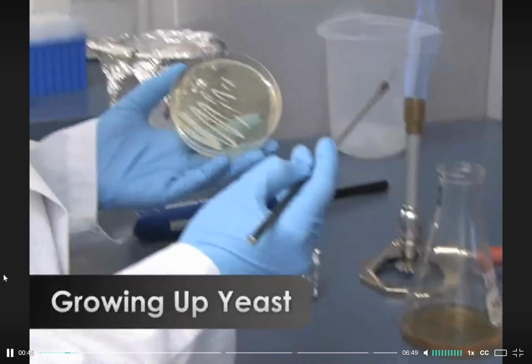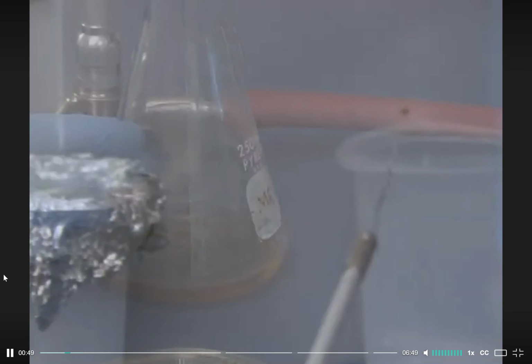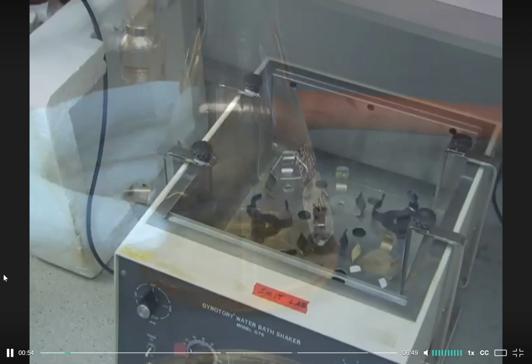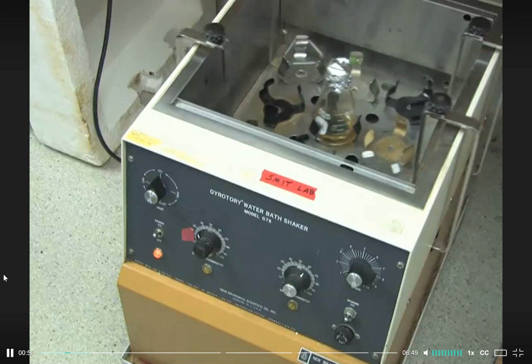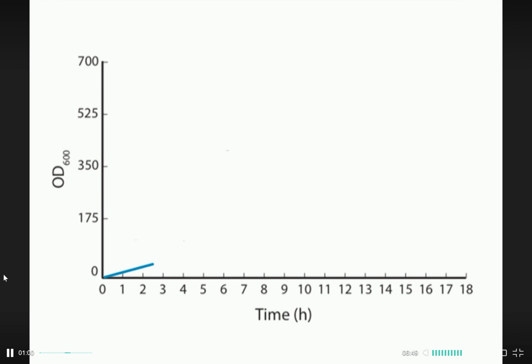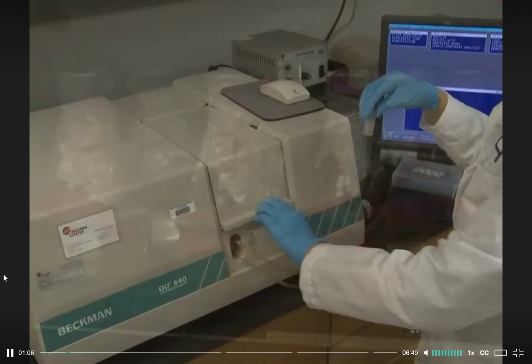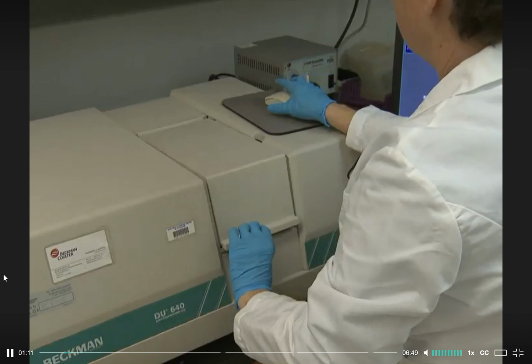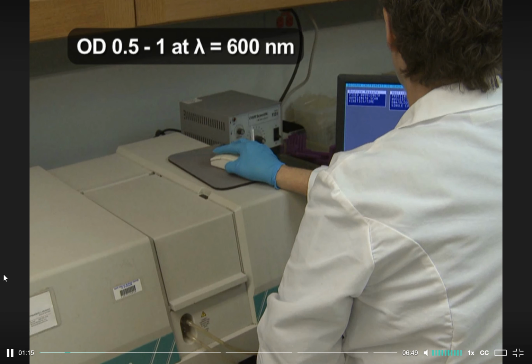Yeast cells are first propagated by selecting a single colony from a plate and inoculating into YPD media. The mixture should be grown overnight at 30 degrees Celsius in a shaking or rotating incubator. Yeast cells should be harvested in the mid-log phase of growth to optimize yield. Yeast in the log phase of growth will usually have an optical density, or OD value, of 0.5 to 1 when measured at a wavelength of 600 nanometers.